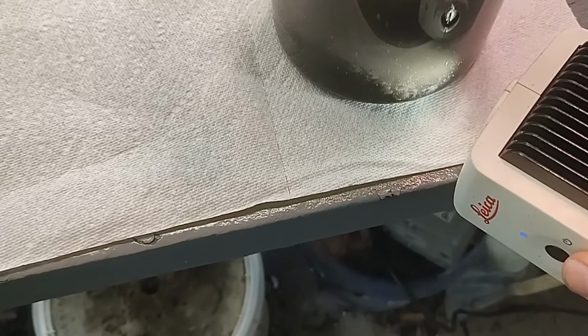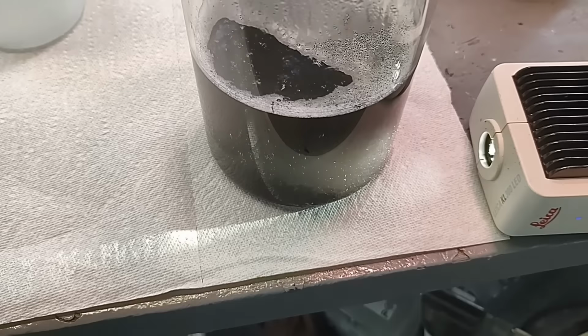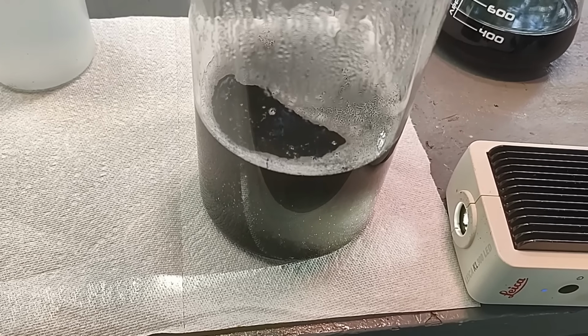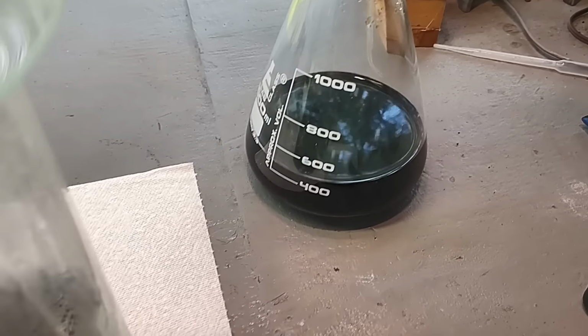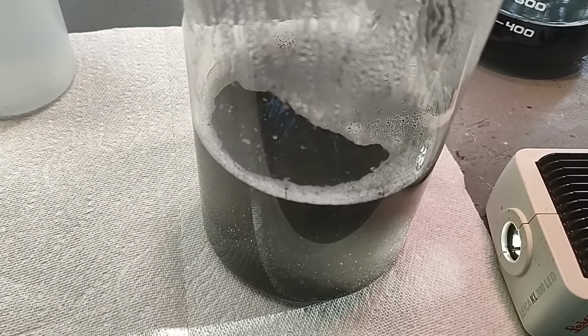And, yeah. See if I can get this liquid to clear up, drop any more palladium out of it. And I'll just have to bite the bullet and go to the store and get some more ammonia and do the second half. Because that's a lot of palladium. I was not expecting that much for half of this liquid we're processing here. So it's very possible I just don't have enough ammonium formate in there.